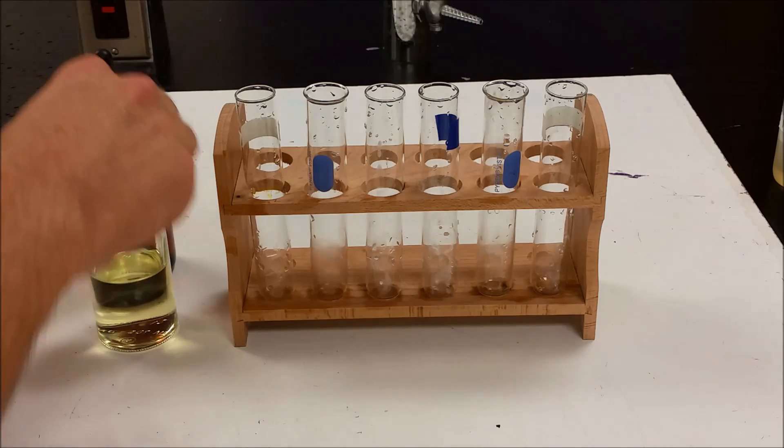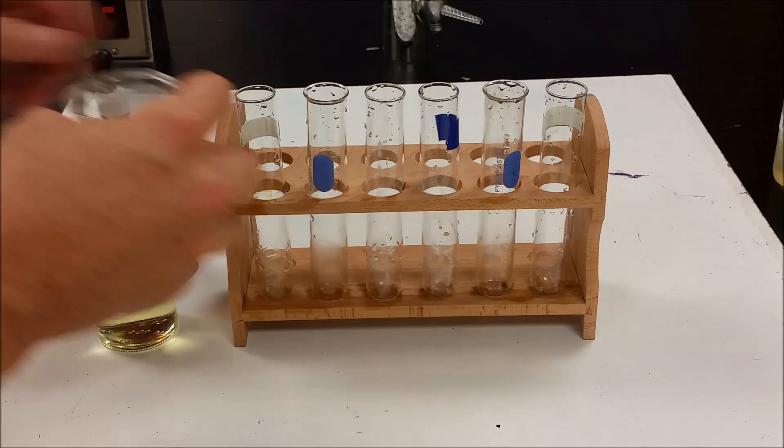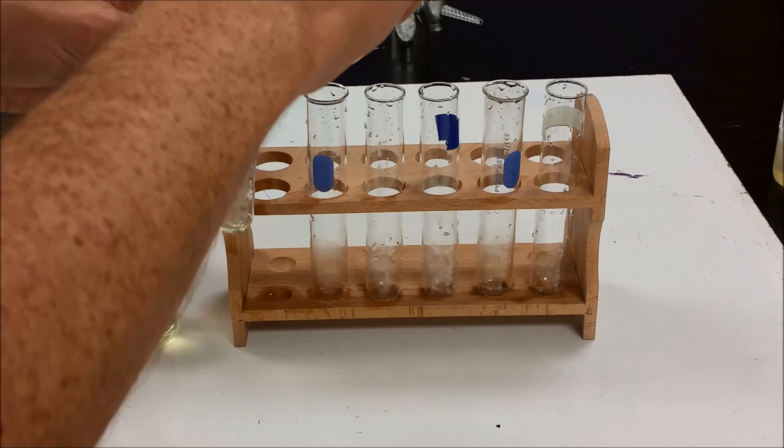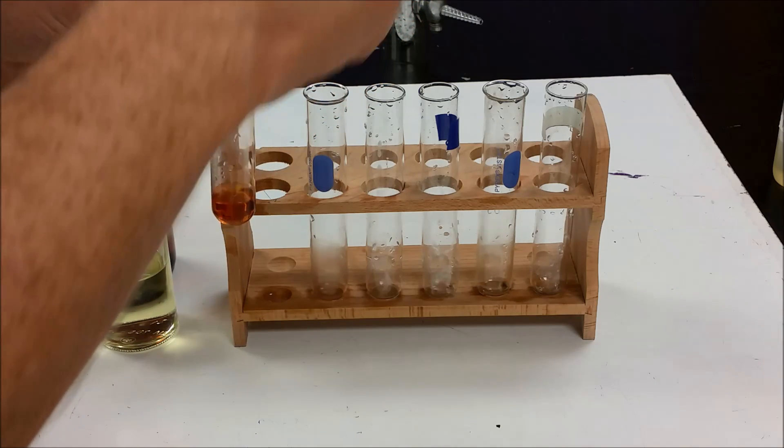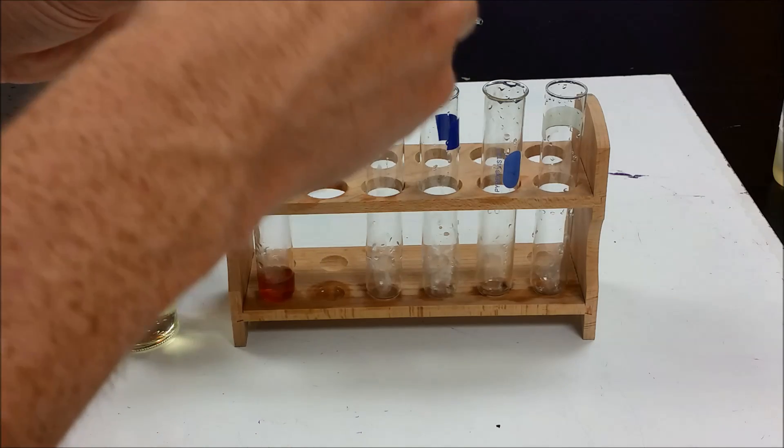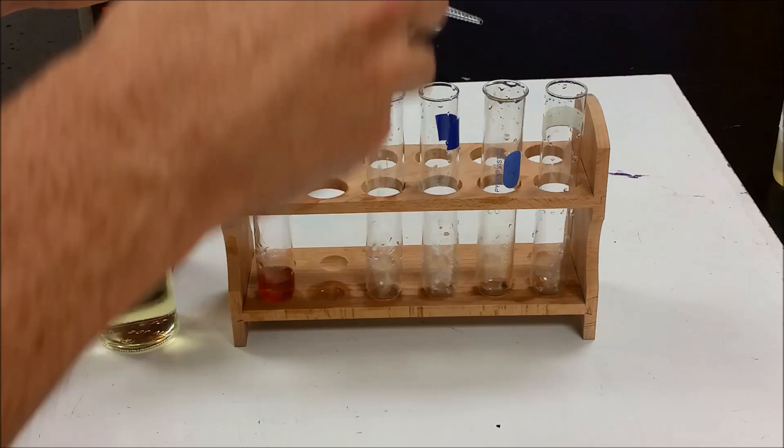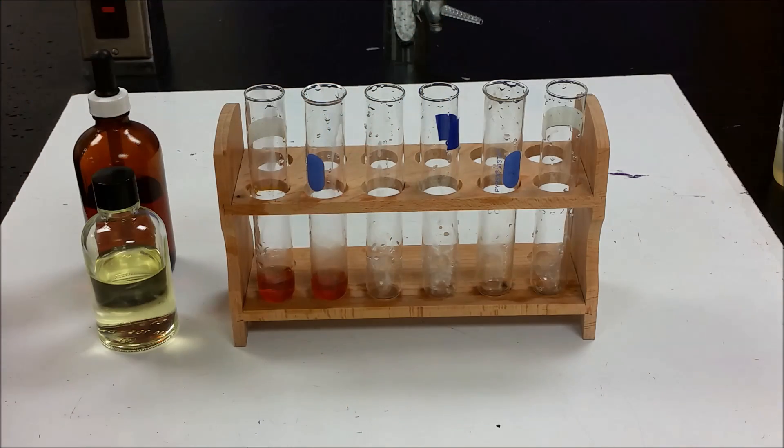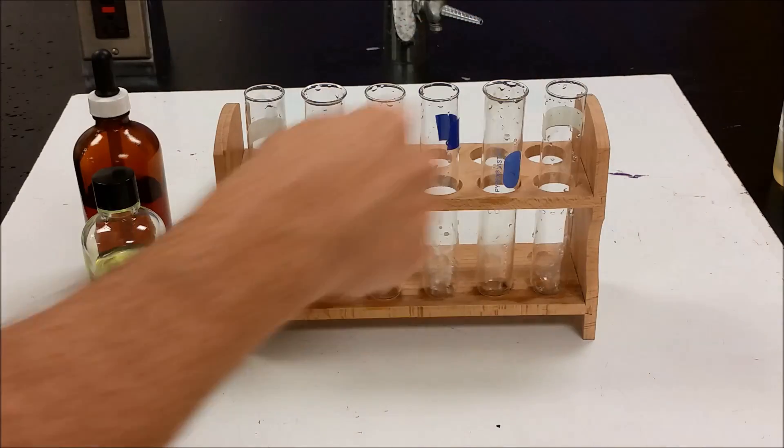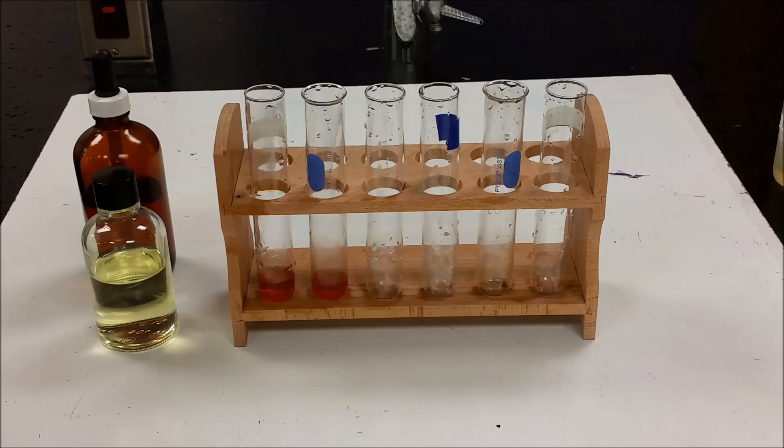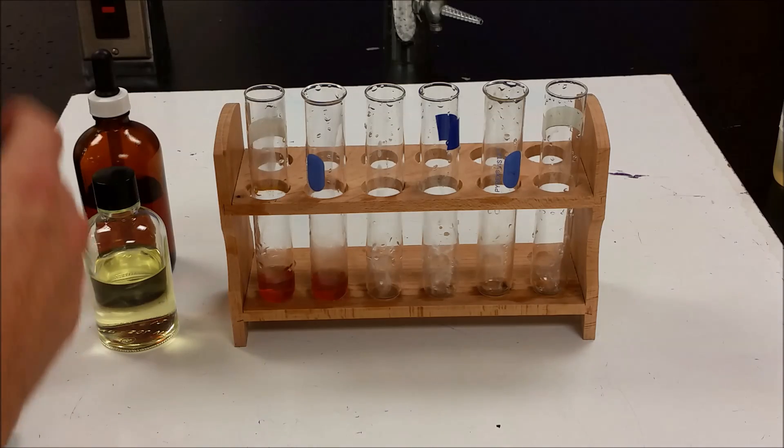So why don't we go ahead and start with iodine. We're going to put some iodine solution in here. It's challenging to get this to dissolve in water, so we've had to warm it up a little bit. To the iodine, we want to add chloride and bromide and see if it reacts.